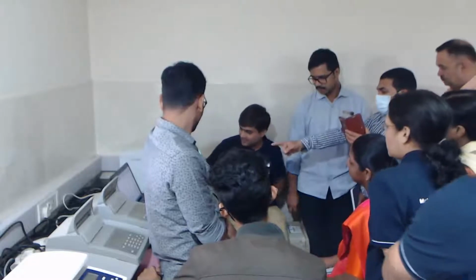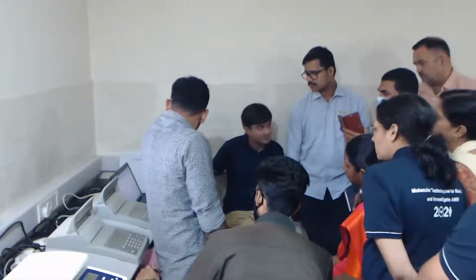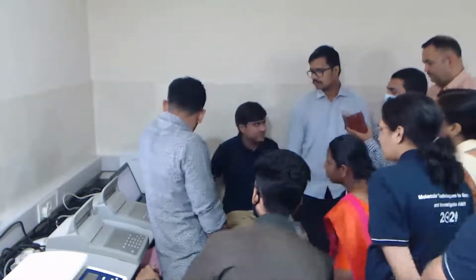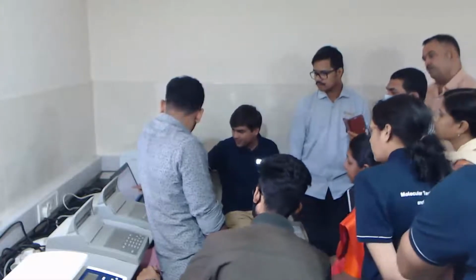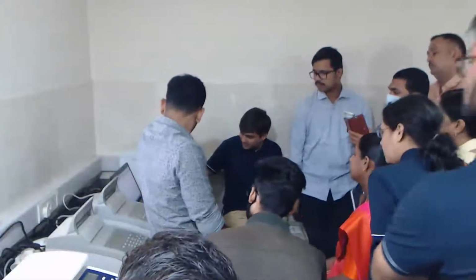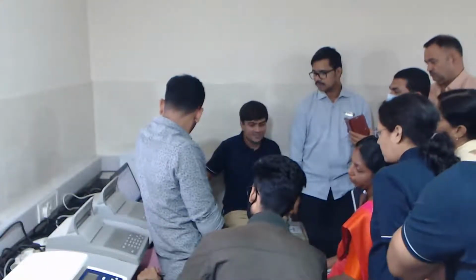Okay, we'll come to that. This is the default image. Based on that, they also give you size and concentration and molarity and everything.